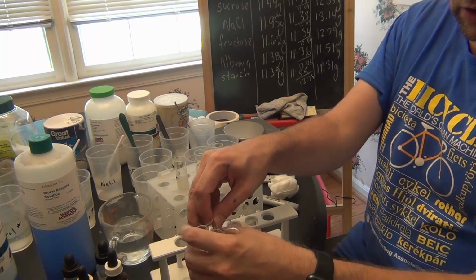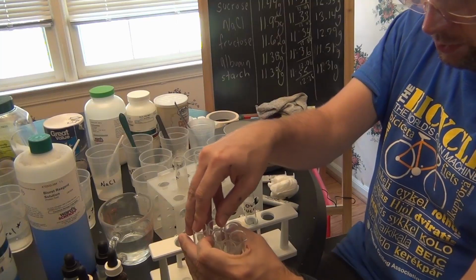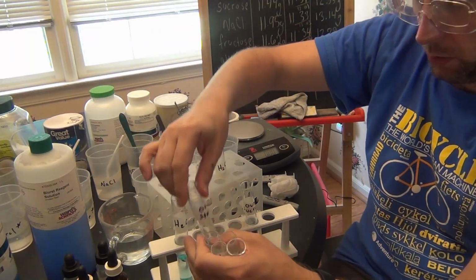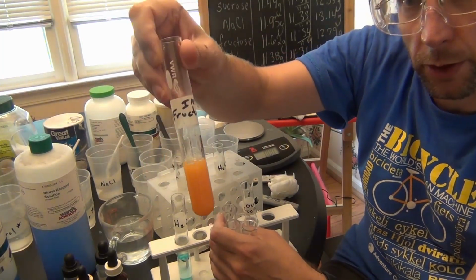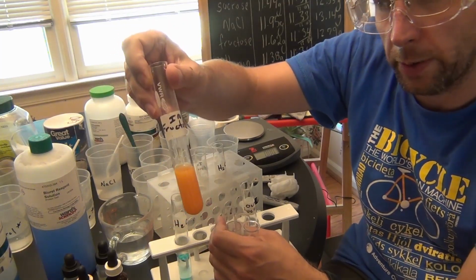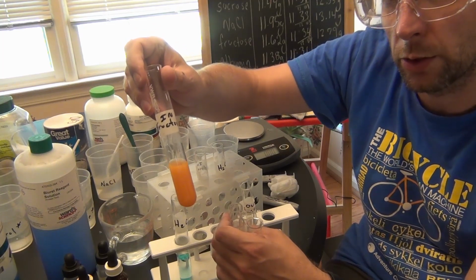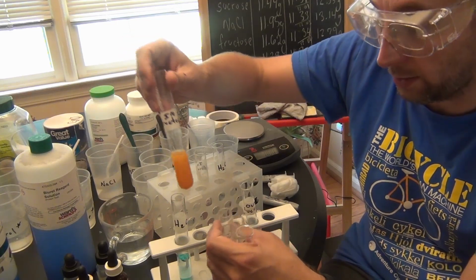Okay, so let's take a look at the results. I'm going to move some of these, try to find the ones I want first. Okay, so this is water. Water is our negative control for Benedict's, and it shows up as a blue color. Then we had the fructose. The fructose is a monosaccharide. It should show a positive result for a Benedict's test. Inside the dialysis tubing, there was lots of fructose. Usually what happens with the Benedict solution is it changes from a green color to an orange to even a darker color, I think sometimes, if there's lots of sugars.